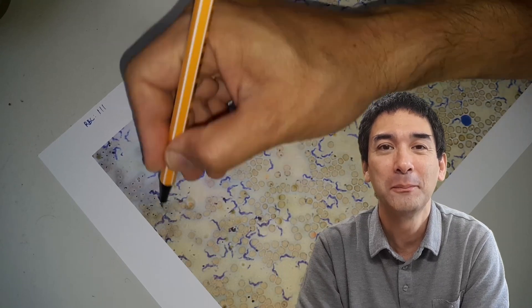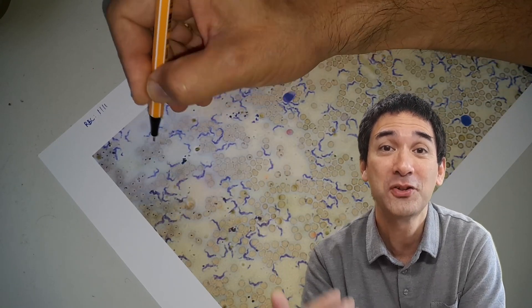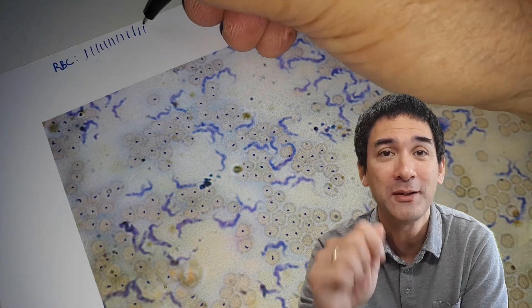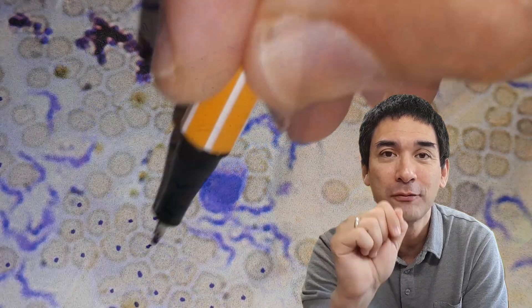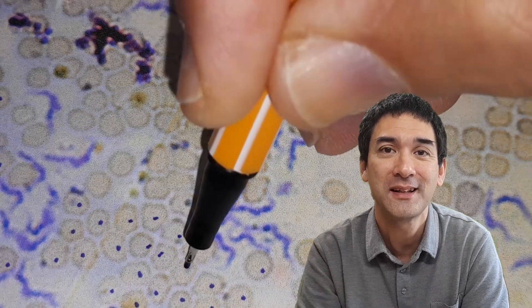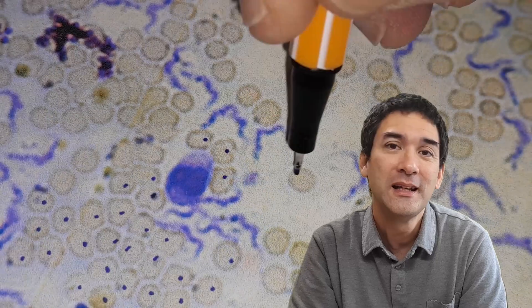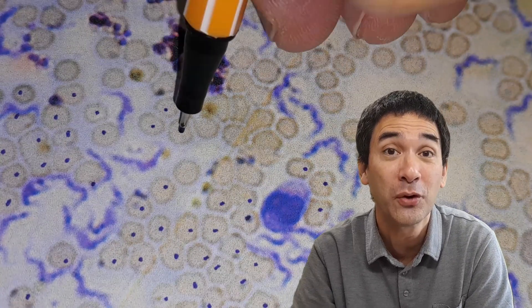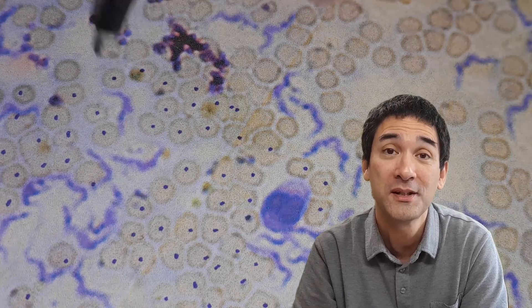It took me a couple of minutes. I generally recommend that if you want to do any counting of specimens, print it out and use a pen or pencil to check off — I made a tick for every 10 cells counted. I counted first the red blood cells, then the white blood cells, which were significantly fewer, and then of course the trypanosomas.